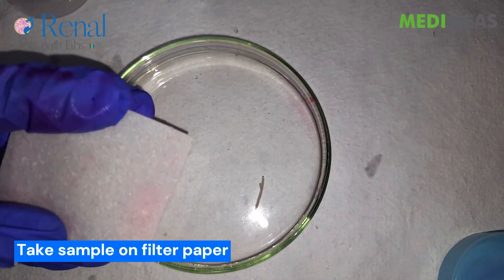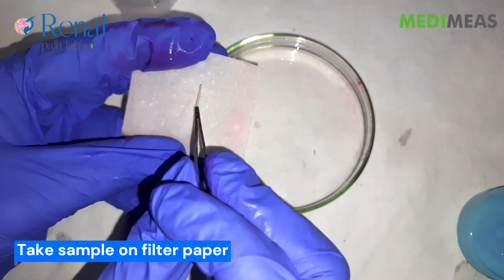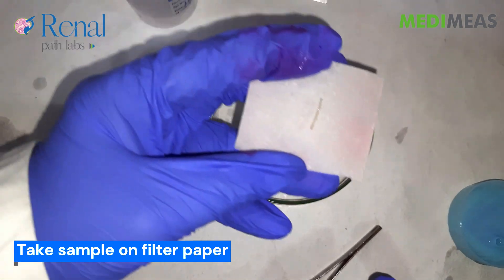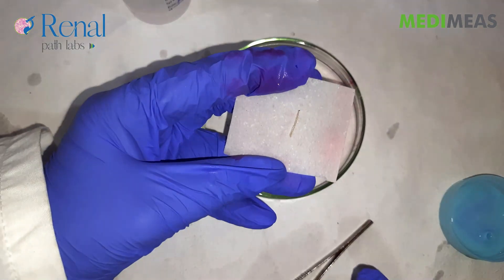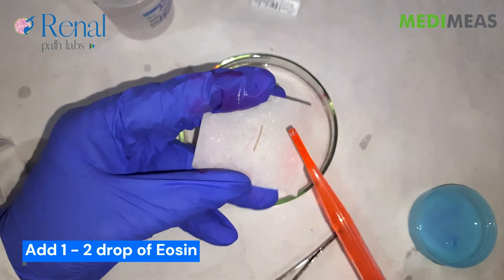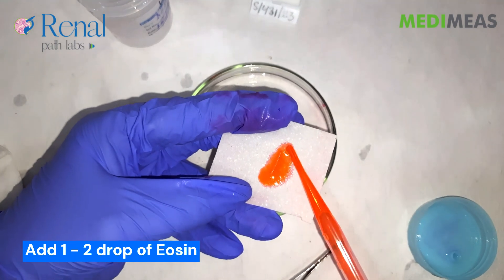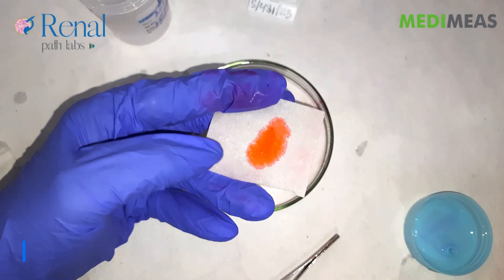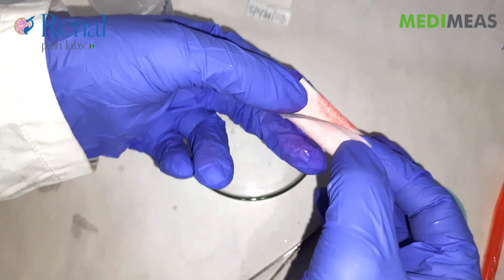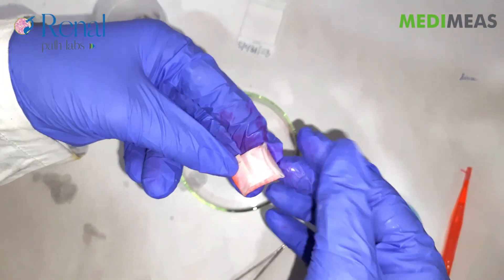Now, we will take a sample on filter paper and add 1-2 drops of eosin. Then fold it and put it in the cassette.